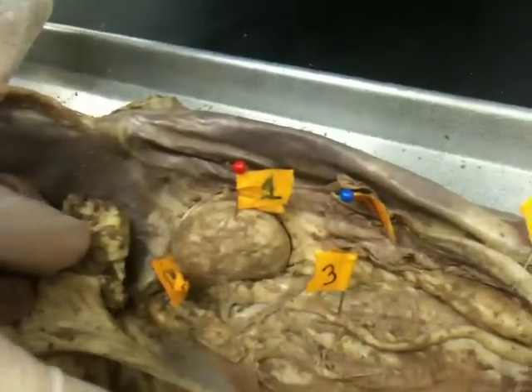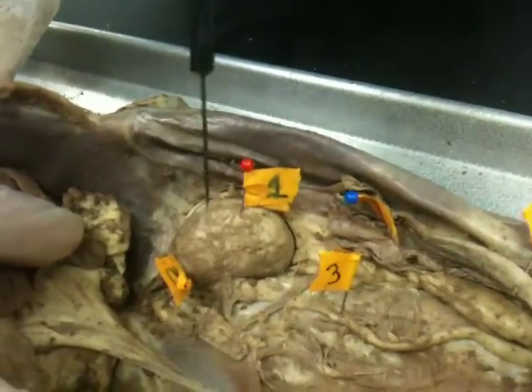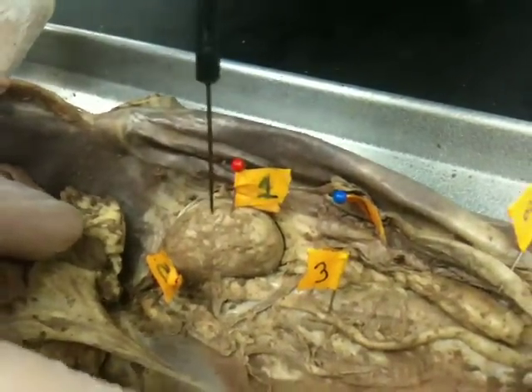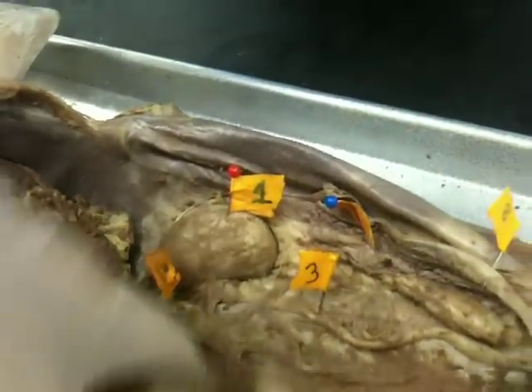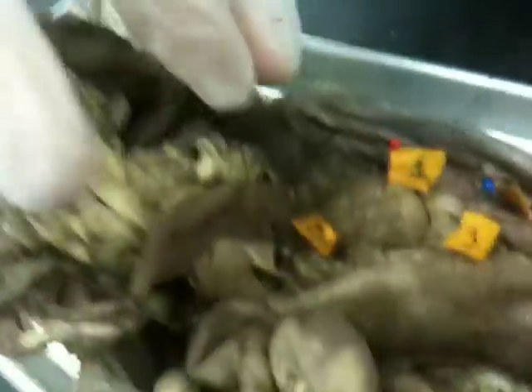We're going to start with the kidney. Obviously, this is the big bean-shaped structure. This is on both sides — you see the same side kidney. So we start with the kidney.